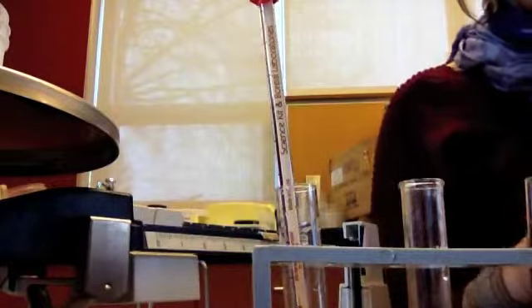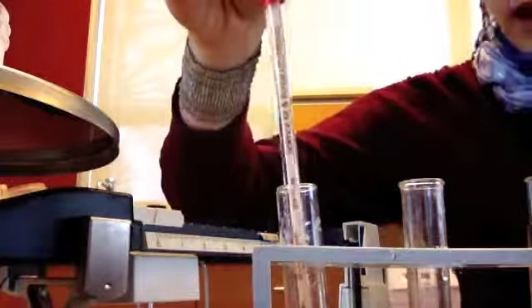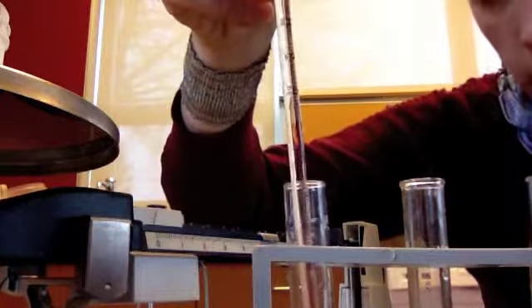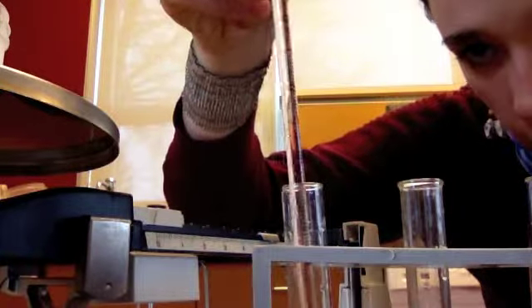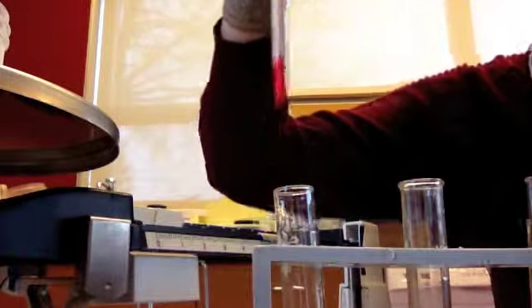So that goes in this table, which you should have. And then you can do the difference and figure out how much sugar was added. And the last piece of data you would need is the temperature. And it looks like right about 20 degrees Celsius. So that's the last bit of data you need for that one.